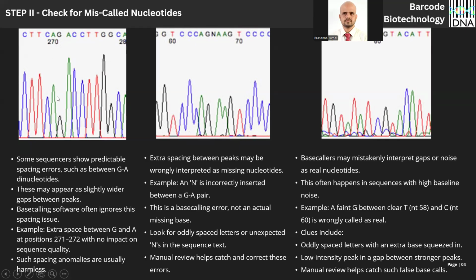This G is correctly called at the 270th position here. The 271st position is exactly G. There is no baseline noise. So the next nucleotide is adenine, which is called at the 272nd position. It is called precisely as adenine. So I would say between this 271 and 272, not much examination is required.